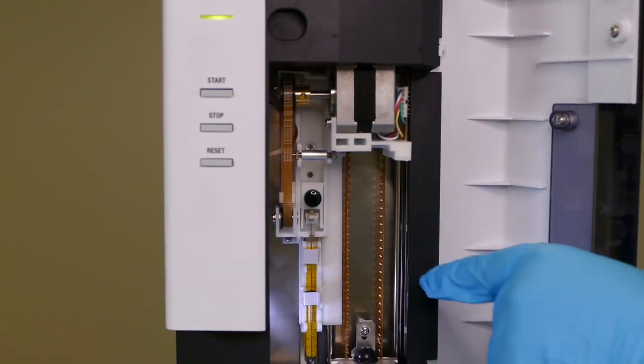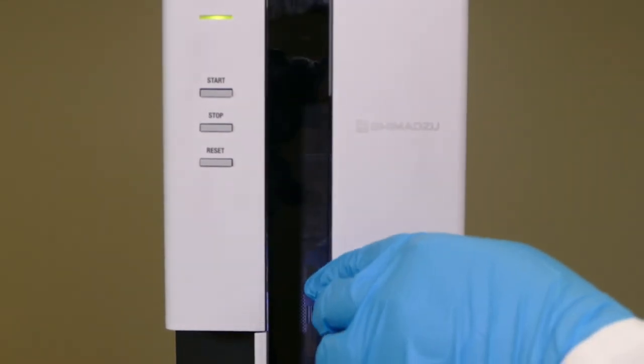Finally, the black screw can be tightened and the auto-injector door can be closed.